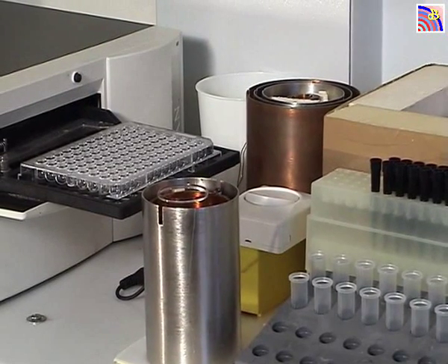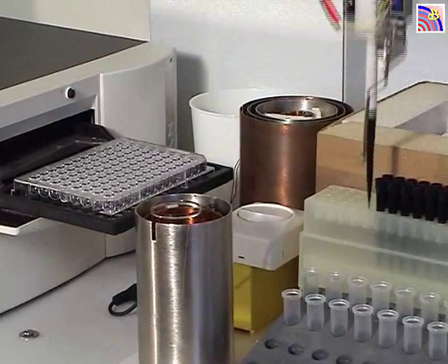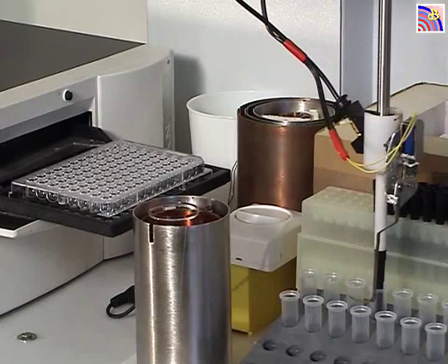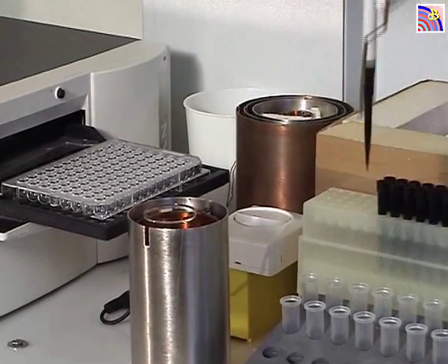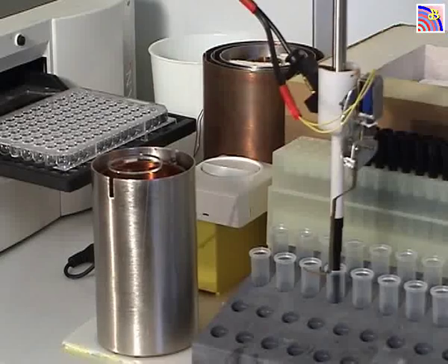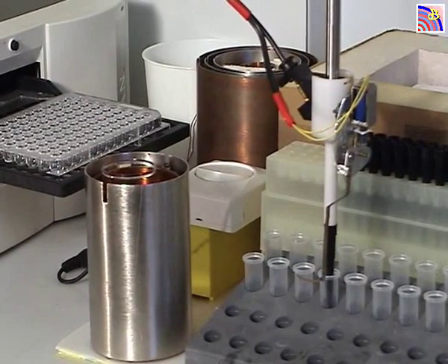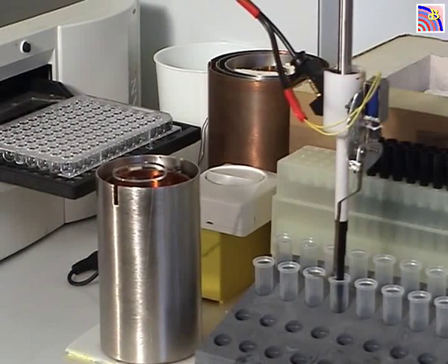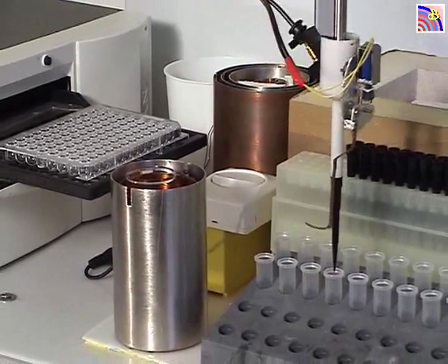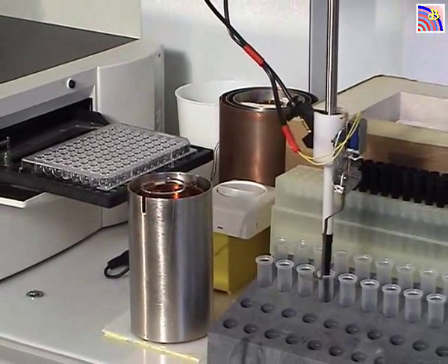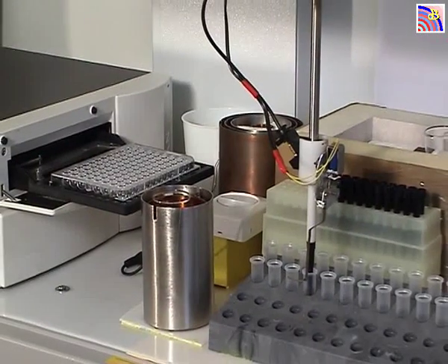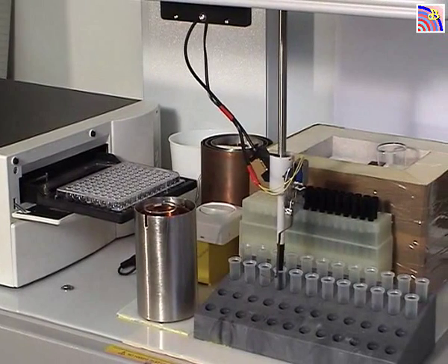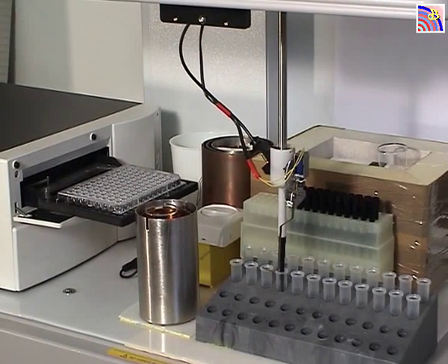Okay, now the fourth one. You can see that every time the arm picks up a tip it gives two small hits so that the tip is well fit into the white plastic cone, otherwise there could be some leakage. Now mixing again on the fourth one, and back to the plate.